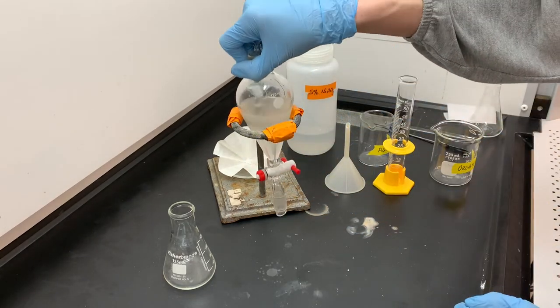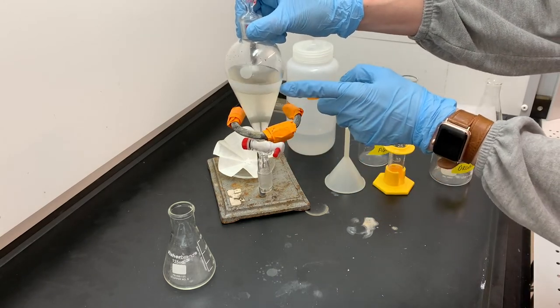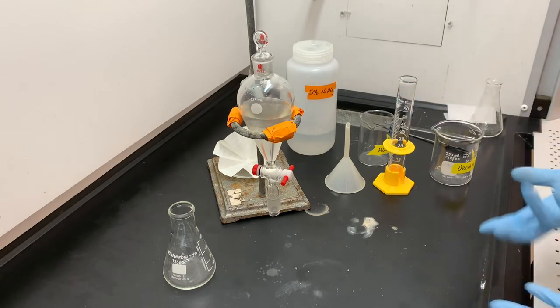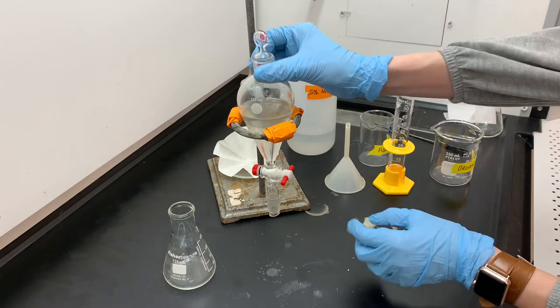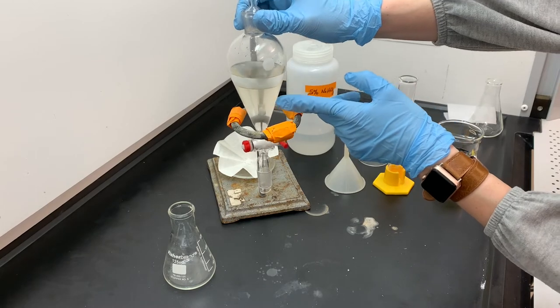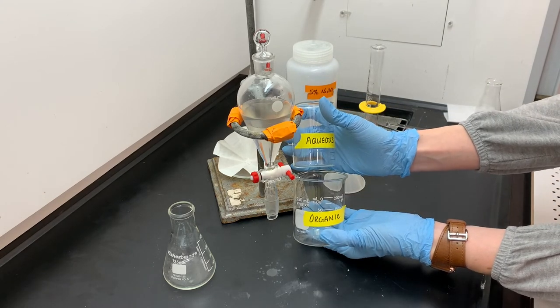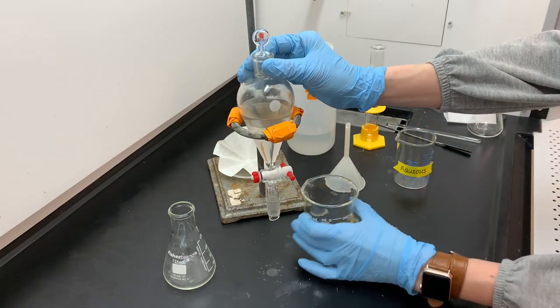I'm going to put the separatory funnel back into the ring and allow the two layers to cleanly separate from each other. Right now there's a little bit of fuzziness between the two layers, so I'll give it a little time to get a nice clean distinction. The bottom layer is the methylene dichloride layer, which I'm going to call the organic layer. The top is the aqueous layer — that's the sodium bicarbonate solution. Organic and aqueous are pretty typical labels to use in the extraction process.